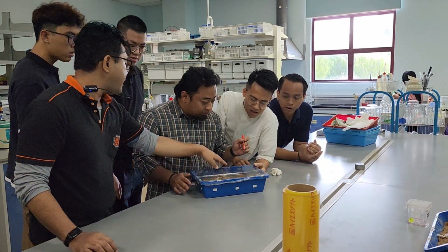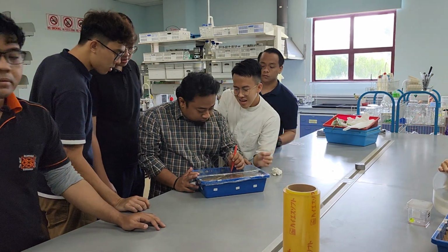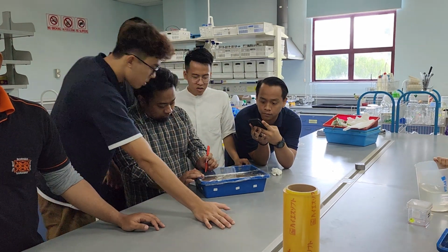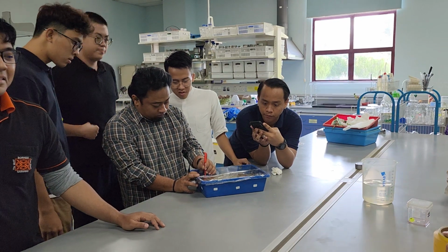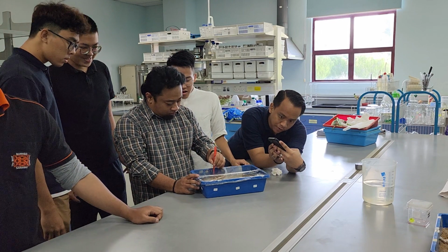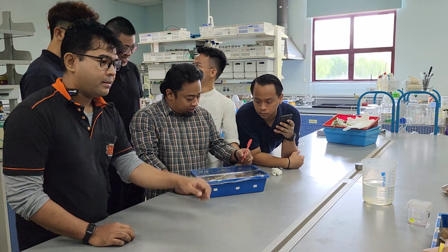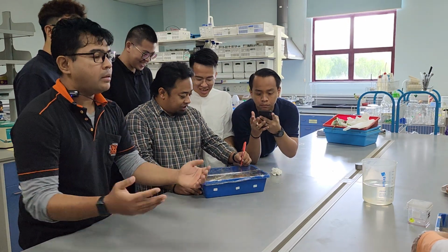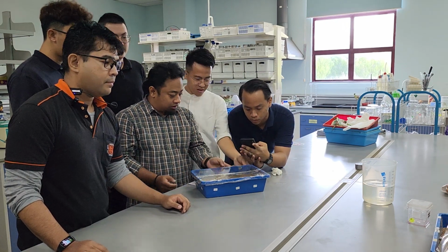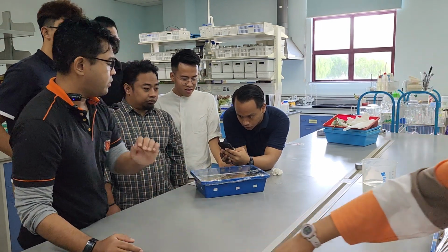Okay. Jauh-jauh sikit lah, jangan dekat. Not enough. Bang, cepat. Orang dah nak siap dah. Cepat. Oh ya. Okay, wrap. Tarik lebih sikit sebab nanti you need to wrap on both sides. Yes. Tak apa. Yang tepi is if not occupying, you use the other one to go this way.